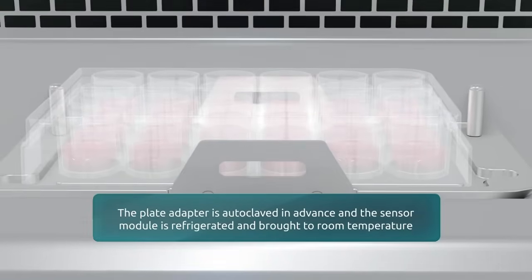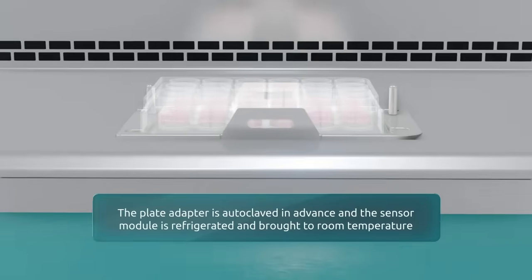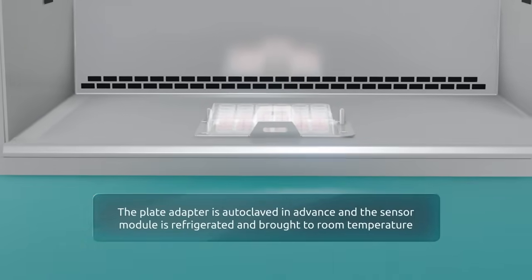Once the sample preparation is complete, place the 24-well plate into the plate adapter and close the adapter cover.